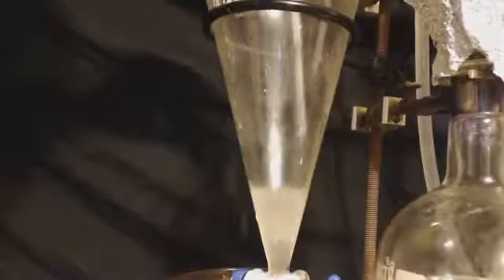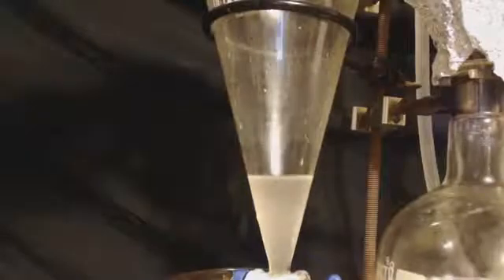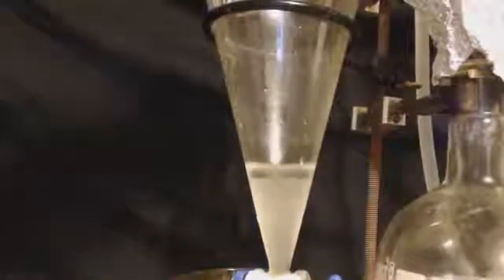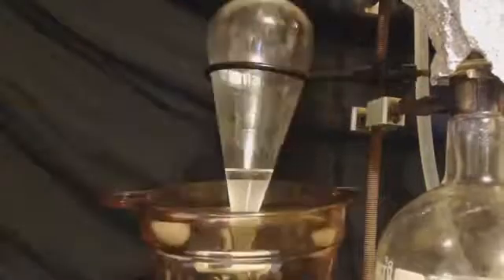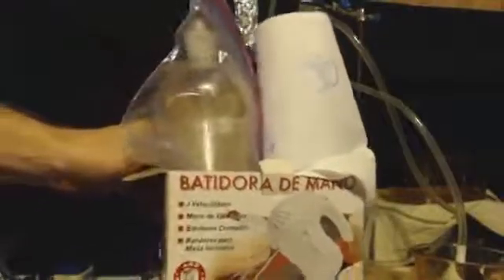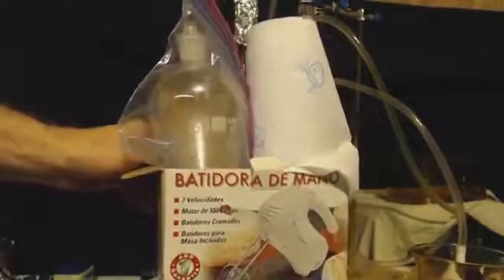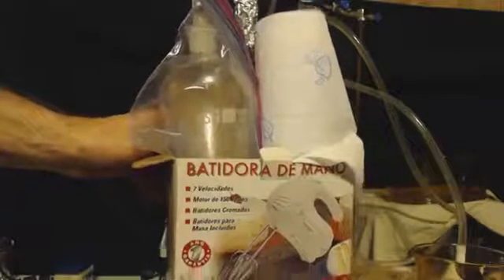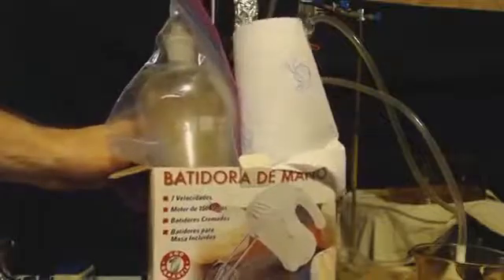Put the ethyl bromide back into the separating flask or separating funnel. And this time, I'm going to put salt water in to get rid of any residual water that may be in there. Shake it up, let it sit 10, 20, 30 minutes in the ice bath. And then that's the last wash. And here's another thing, if you want to put it in your freezer where your food's at, maybe put it in a Ziploc bag, make sure it's Ziploc'd up and upright. I'll have it in the box jammed in there so it won't fall over. But that's not for long-term use. I wouldn't trust it.